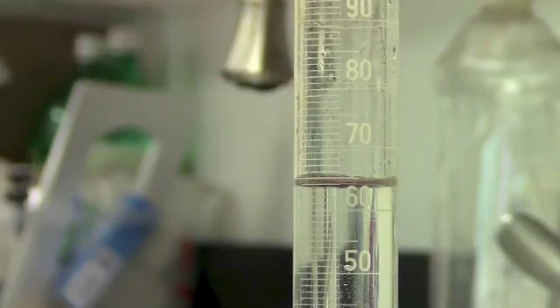I can take a new volume measurement. This is my final volume. And this looks like it's 64.0 milliliters. I'm going to say .0 because it looks like it's exactly on the line for 64. Therefore our final volume is 64.0.